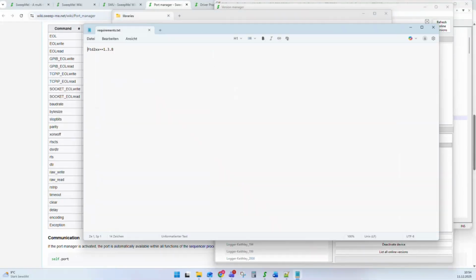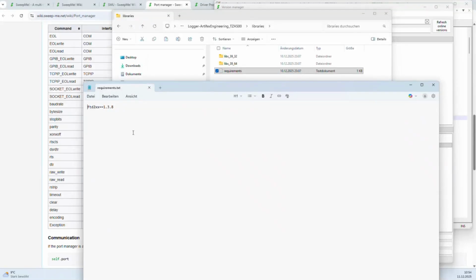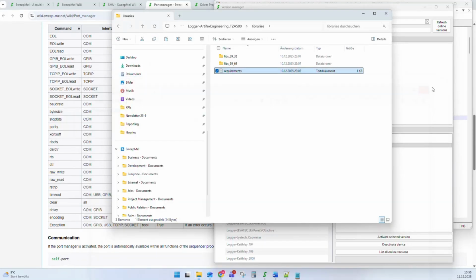And if I open this requirements file, for people that are familiar with Python, they know that the requirements.txt can be used to define a Python environment. And what you do is you take the name of your library that you need and tell which version you want to have shipped with. And we have a tool that is called Library Builder. You can use this file with the Library Builder, and it will automatically create these libs folders for you and put them in here. And it will search for all subdependencies in these packages that are not yet shipped with SweepMe. So this is one option.